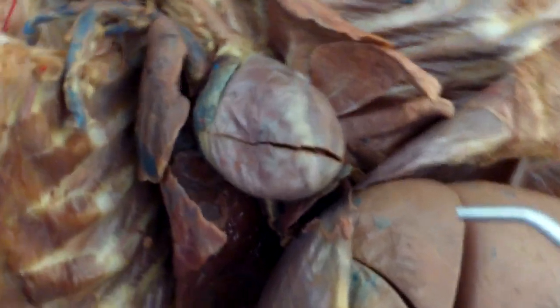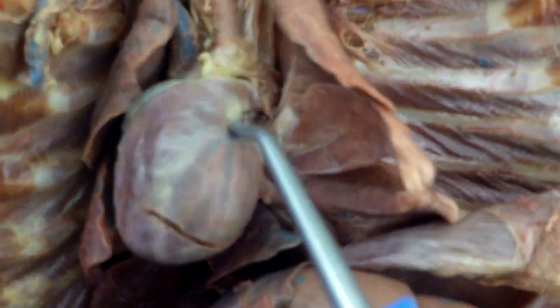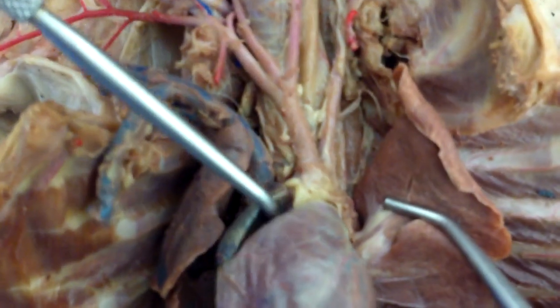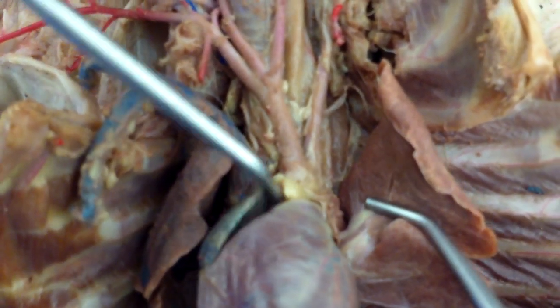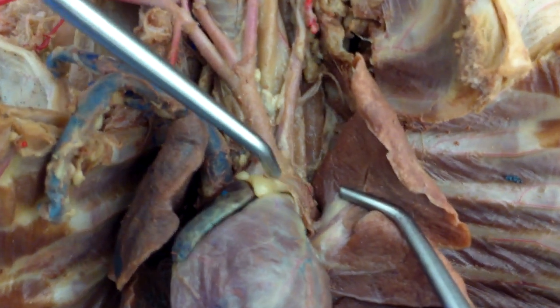Start with the heart. You have the ascending aorta — want to point that out? The ascending aorta turns into the aortic arch.